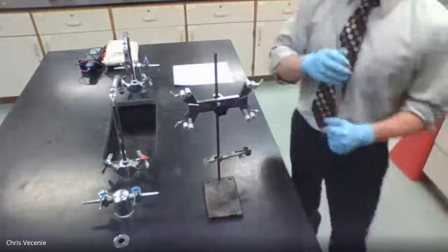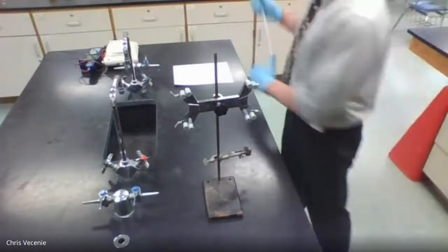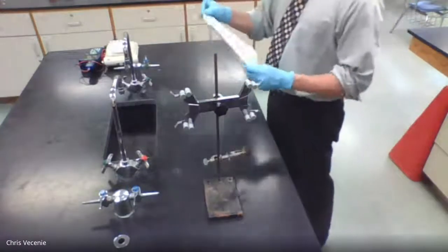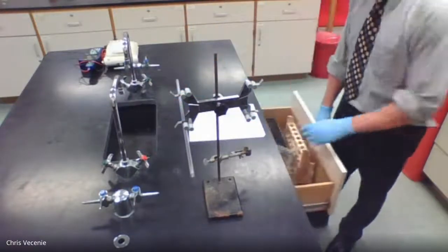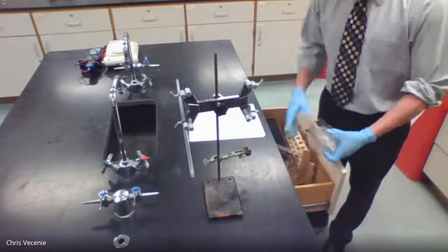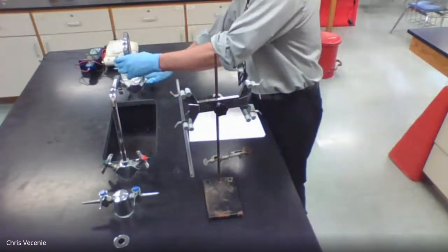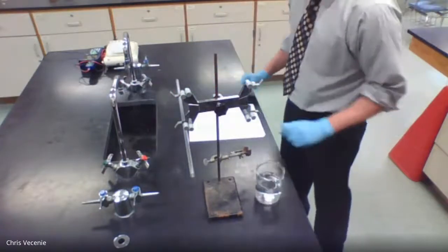All right. Now, what I need to do is prep my tube. So if you look and follow along in your procedure, the first thing it tells us to do is fill up a 400 milliliter beaker about 3/4 filled with water. So you go in your drawer, your second biggest beaker is your 400. We're going to fill it 3/4 full of water, so we're putting about 300 milliliters of water in like that.